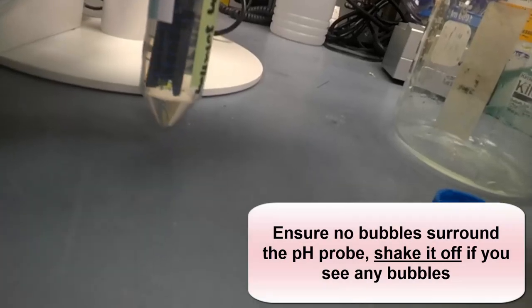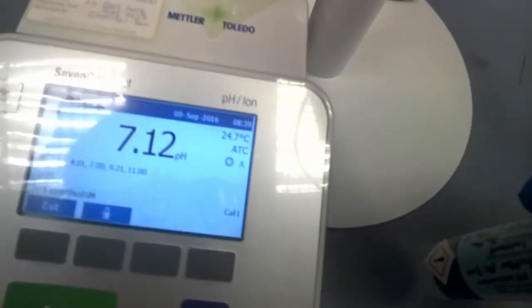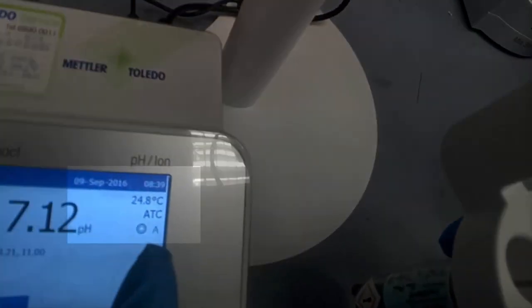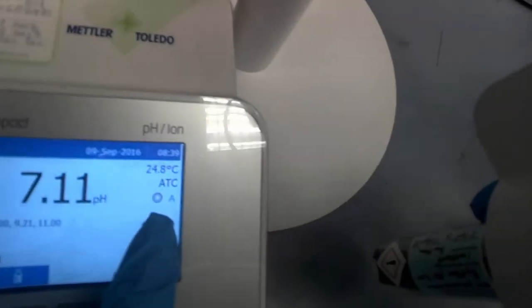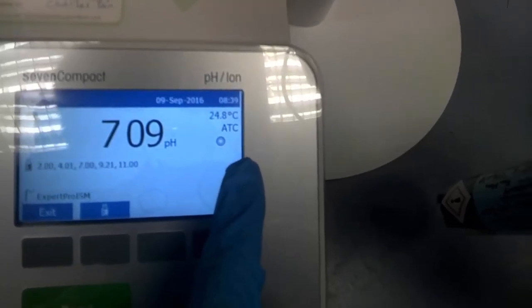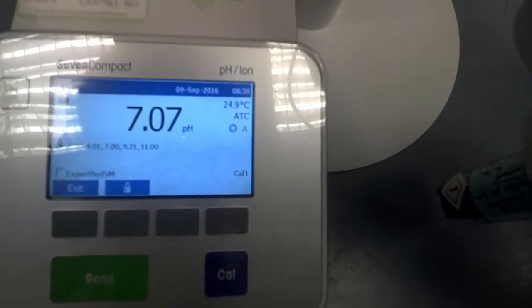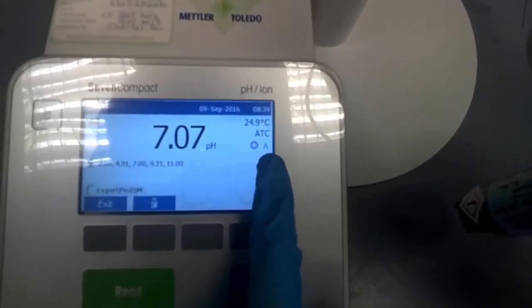Now you notice that during this calibration, this probe here, the sphere, mustn't have any bubbles around it. It should be fully submerged into the pH buffer. And what you do is you watch the panel. Do you see this part here? This A here means it's still calibrating. It's still waiting for results. Do you see this circle? That means the instrument is still doing its job. So just hold on. If it's done, it will show another signal. Watch out for this part.